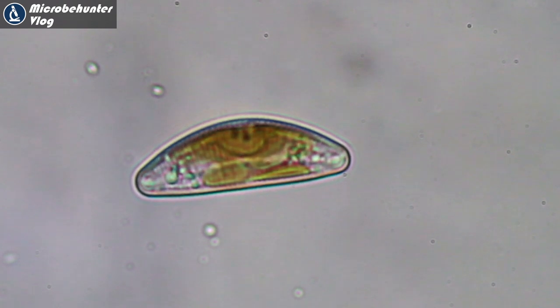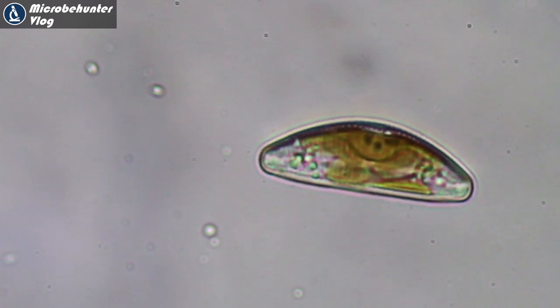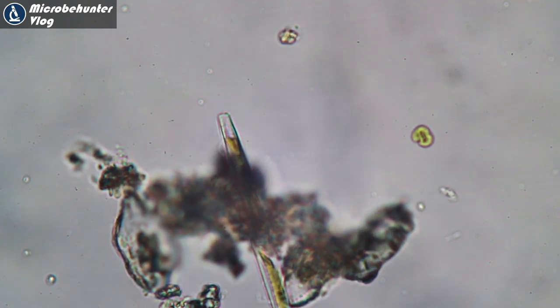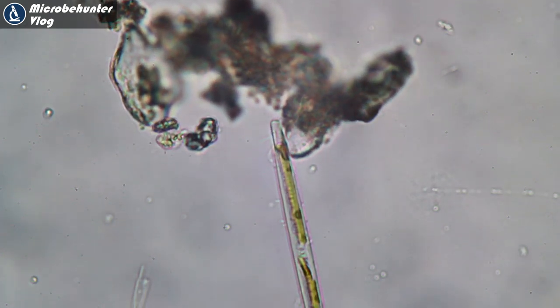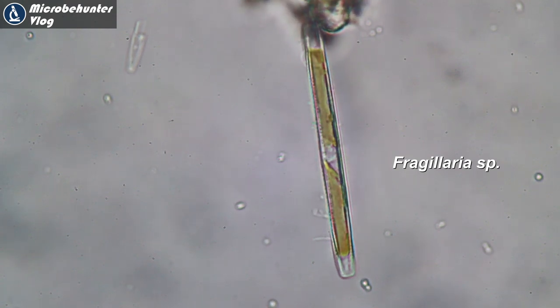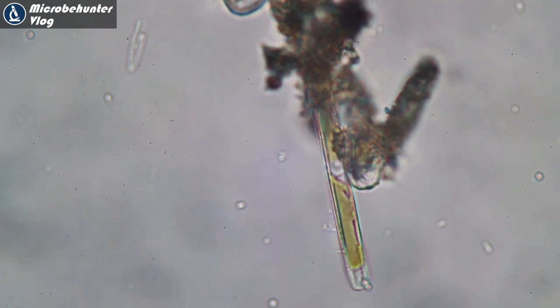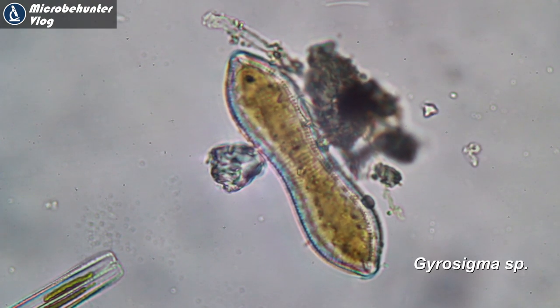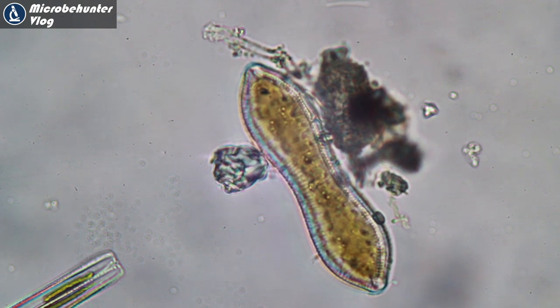A little bit of movement and motion makes every microscopy video much more interesting. Sometimes it's not only the diatoms that move — the moving diatoms drag along other particles as well, some debris, decaying plant material, maybe soil particles. Many of them go back and forth, reversing direction constantly. It seems coordinated but not very directed. This one here is also a diatom — they have very interesting and varied shapes.